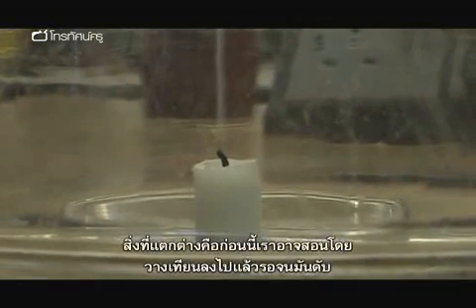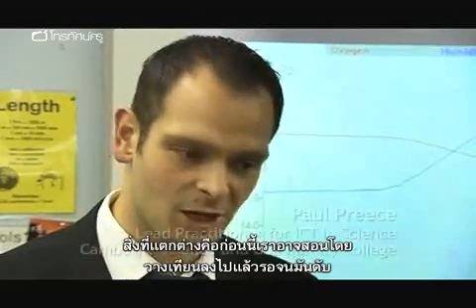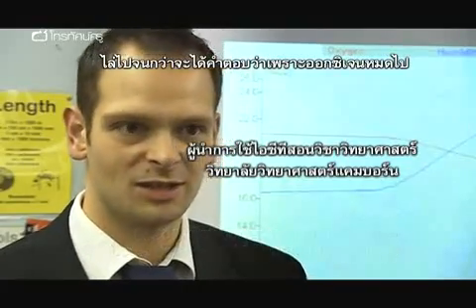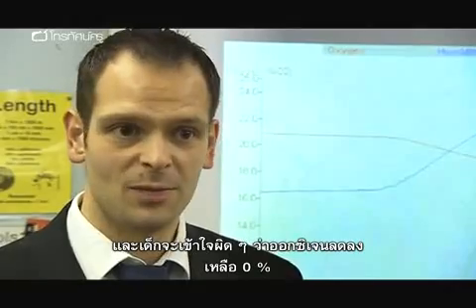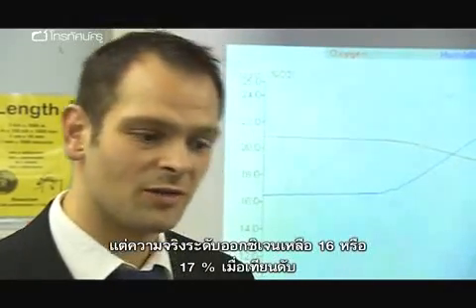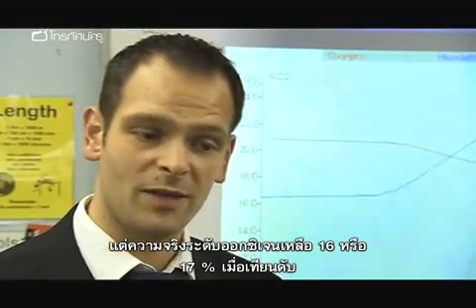Okay, thank you. The difference is before, you would have said, all right, let's put the candle in, and you would have let it go, and you would have said, why does it go out eventually? And you would have come round to the decision that eventually the oxygen runs out. And then they would pretty much, and it's a huge misconception, believe it would go out at 0%. But in fact, it's only around 17 to 16% that the oxygen level goes to when the candle will go out.